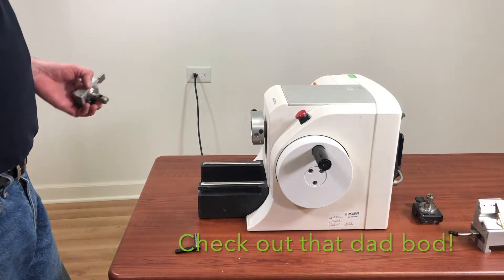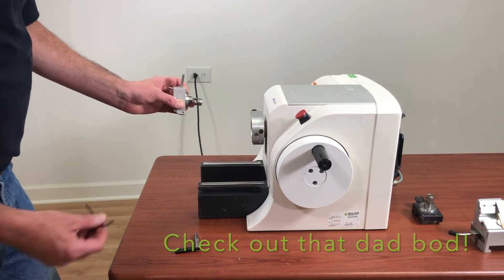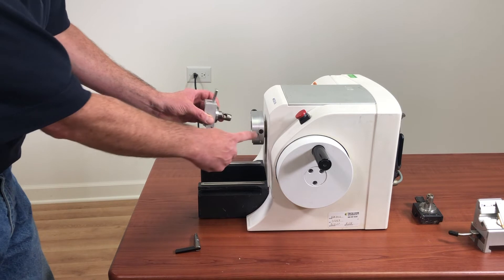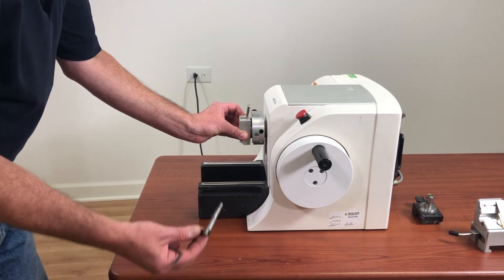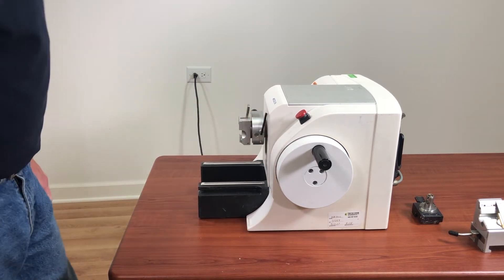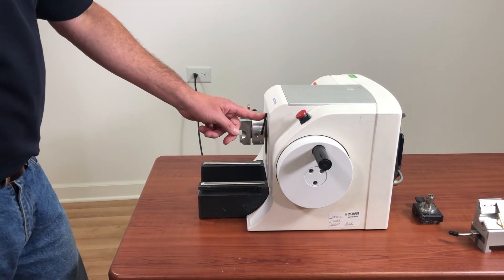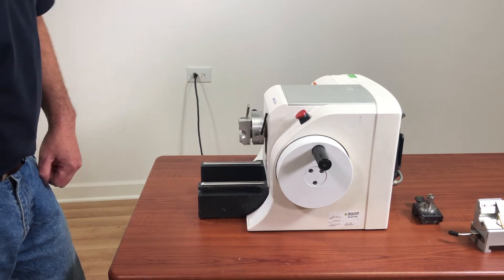To test whether we adjusted it enough, we're going to install the cassette clamp back in the microtome. We're going to take this hole and orient it with this hole, push our cassette clamp in, then take our lever, push it in, and try to lock it. In this case, I didn't quite get it adjusted enough, because I can push this back fairly easily so that it's touching the microtome case.